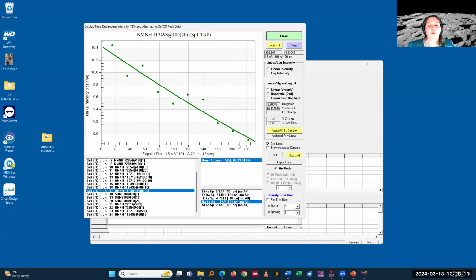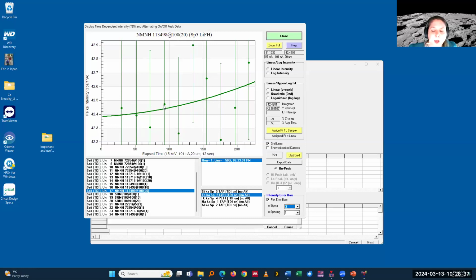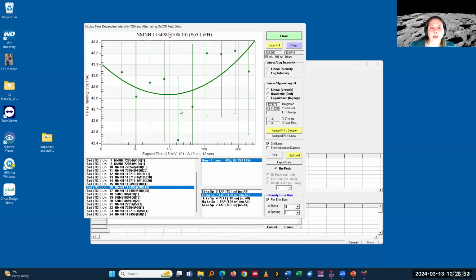You can just remove it. So oftentimes it's just a tool to monitor and not necessarily then apply the corrections if you don't find it. And I would say don't correct if there's not a real change, because if you just have some counting statistics error, and you can also have it shown with error bars, it applies a correction, but this is just counting statistics. So don't correct that, because then all your data has a little bit of random error applied to it. But yeah, it's very easy to look through the data with that and micromanage that.